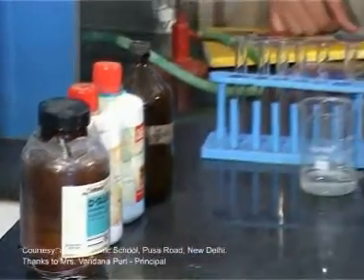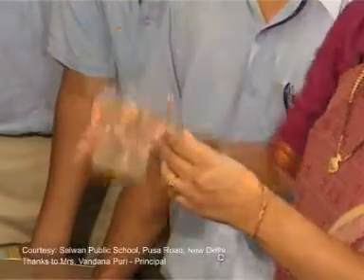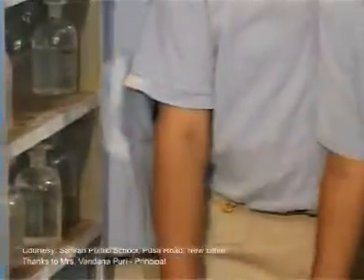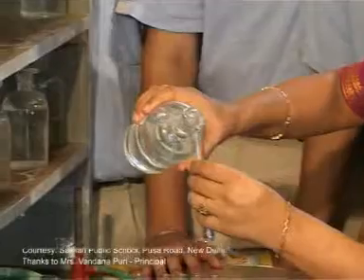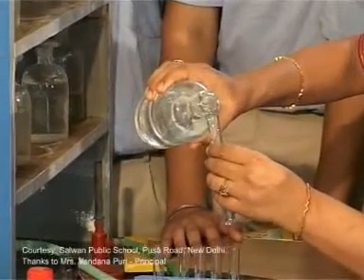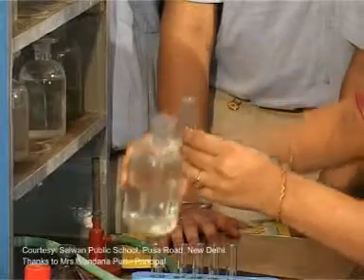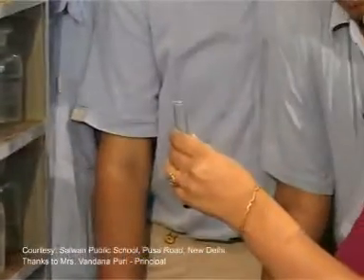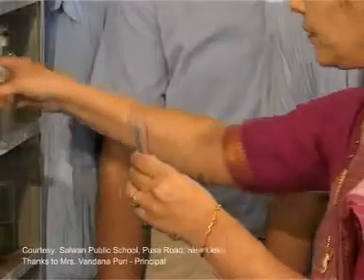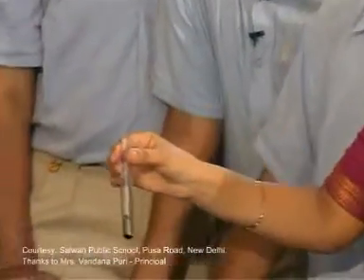Let's perform the first test. Take some amount of the glucose solution, now add concentrated sulfuric acid slowly, very carefully, drop by drop. You will observe charring of the solution, which confirms the presence of glucose.